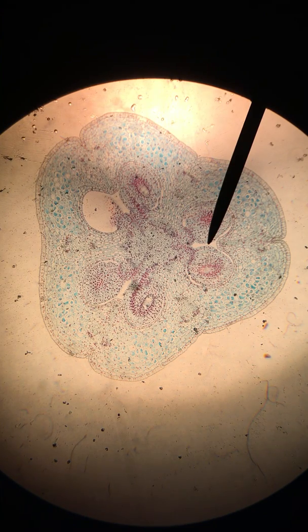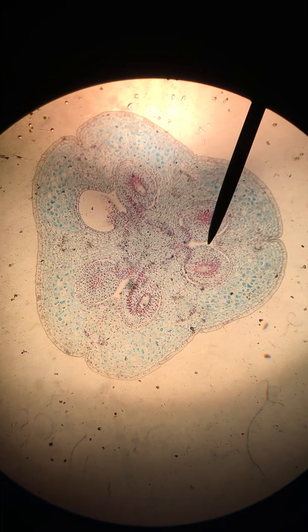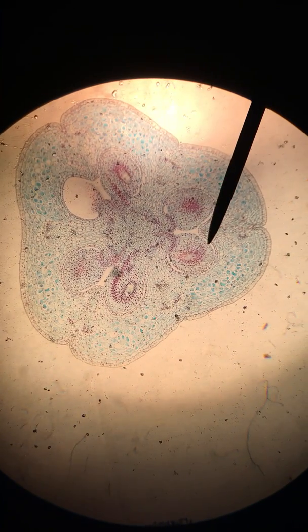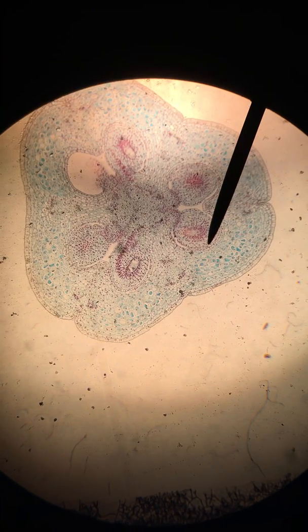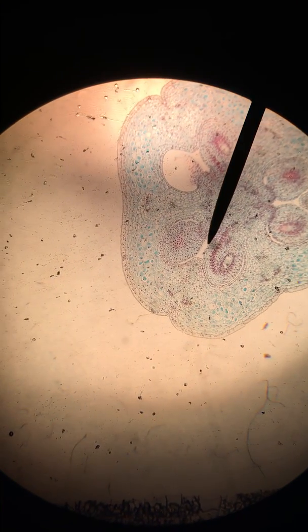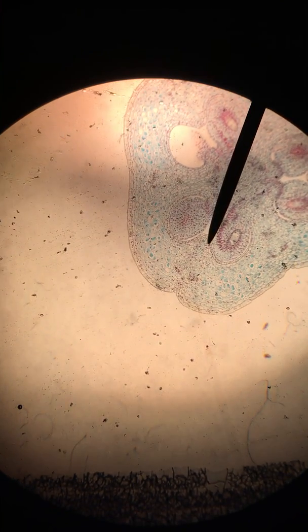As you can see right now, the pointer is hovering over a white space that surrounds each of our ovules here. It actually continues around, all around this ovule. And of course this will be present in each of the carpels as well, so here's another space or locule surrounding this ovule.